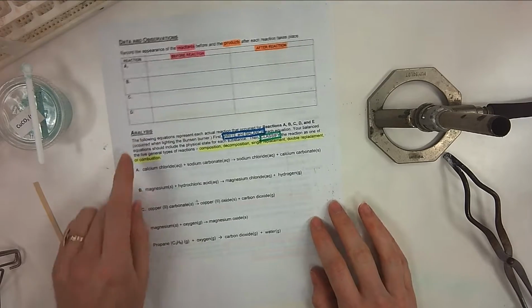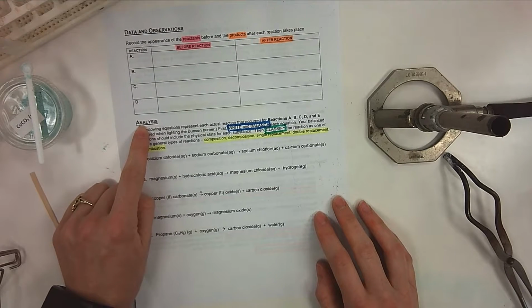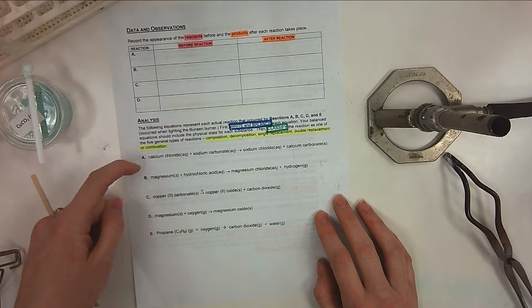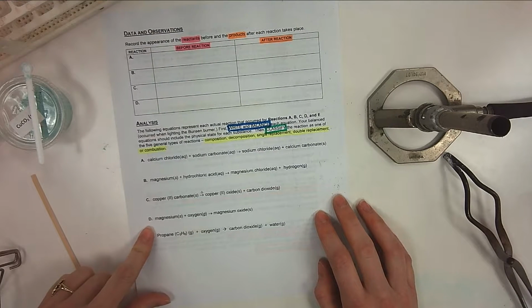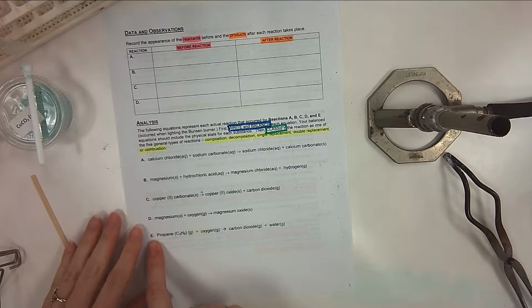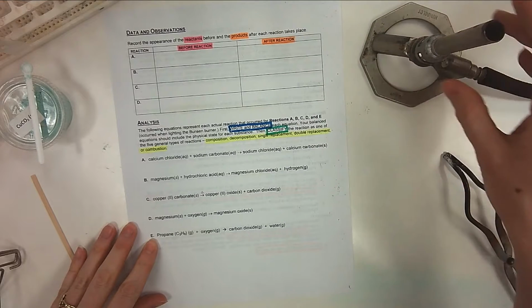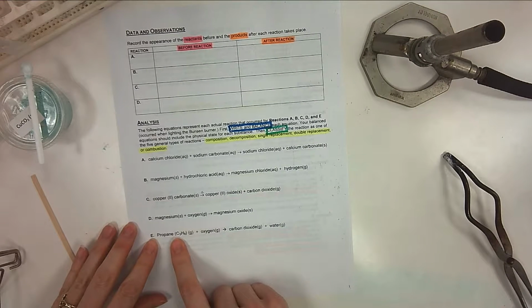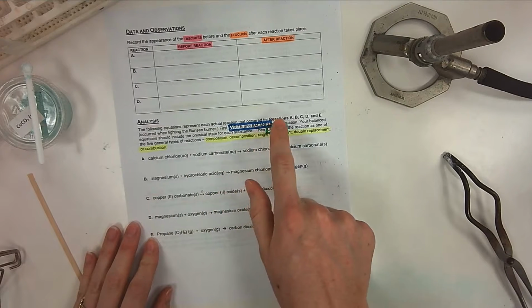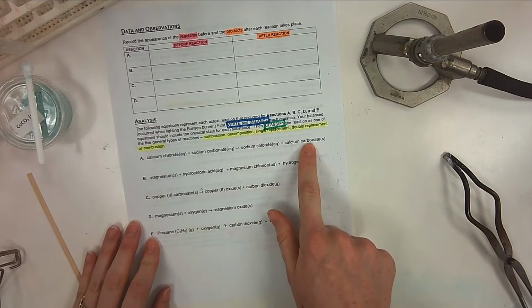All right, so after you've cleaned up, you're going to move on to the data analysis portion of the lab. So each of the 4 reactions we did in A, B, C, and D correlate with one of the types of reactions. E is an extra one, so E has to deal with us lighting the burner, because the burner has propane gas. So what you're going to do is first write and balance each equation. Notice how they are in word formulas.